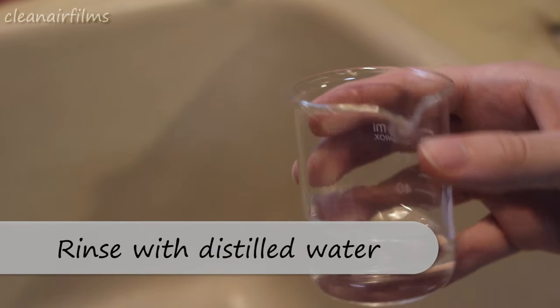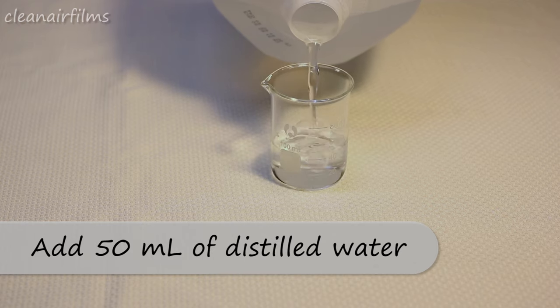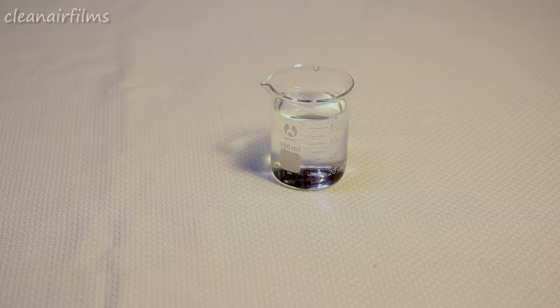Rinse out your beaker with distilled water to get rid of any contaminants. Next, add 50 milliliters of distilled water to your beaker.